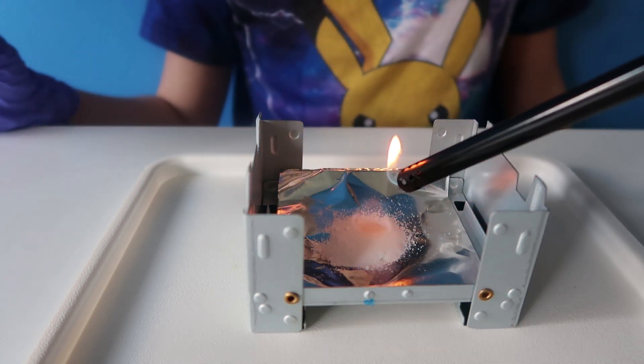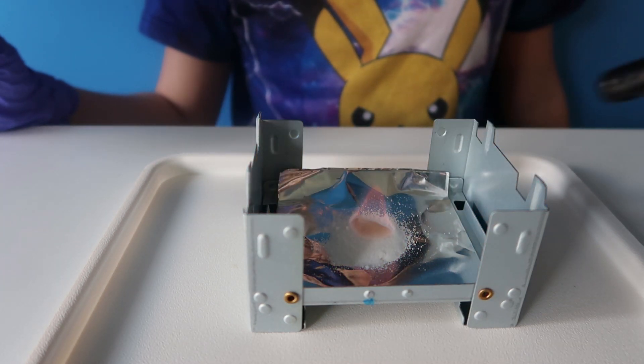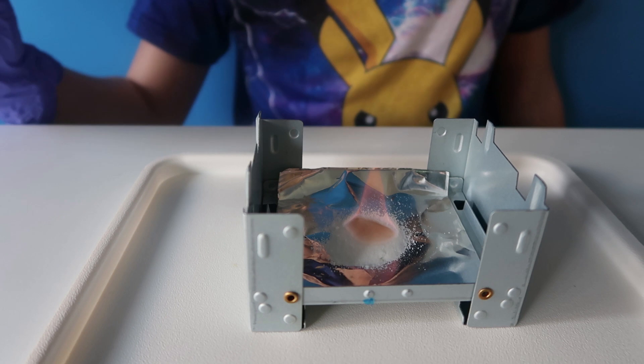It's glowing! There you go — can you see the flame? Yeah, that flame looks cool. It's like the marble in the flame for 15 seconds.